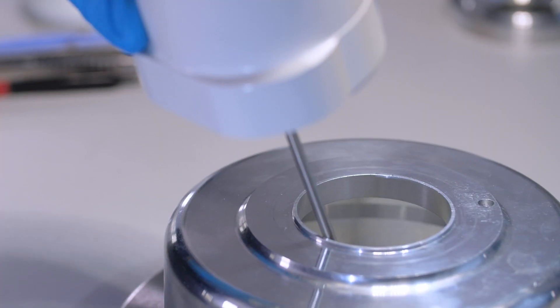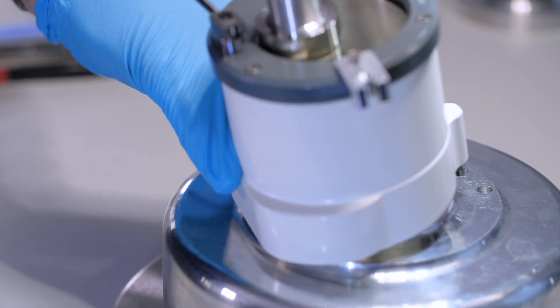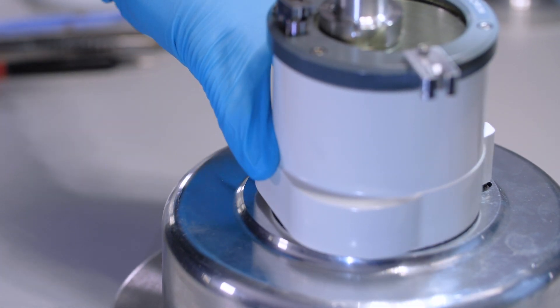And we slide the transfer pot back down onto the slusher ready to pump the sample for a transfer to the airlock.